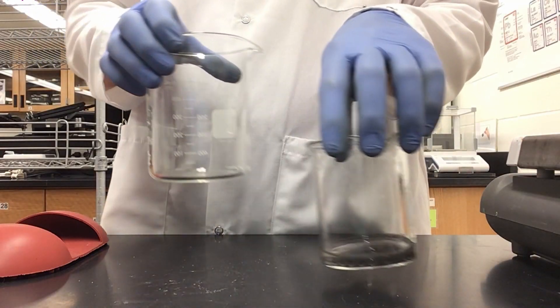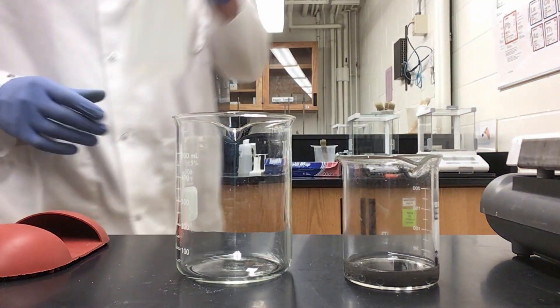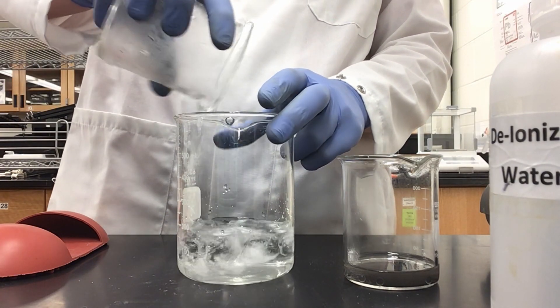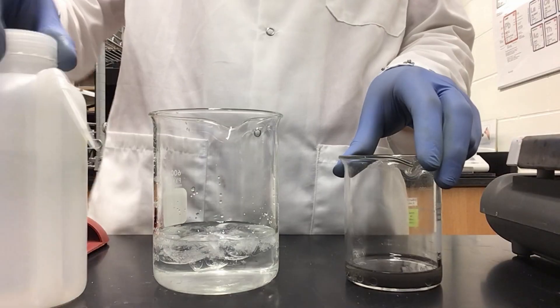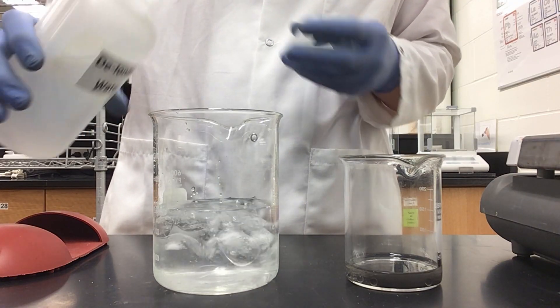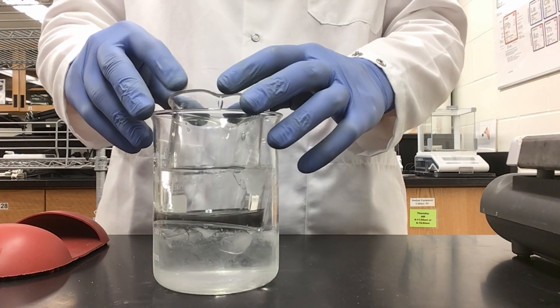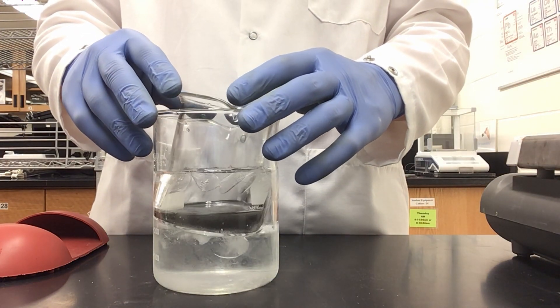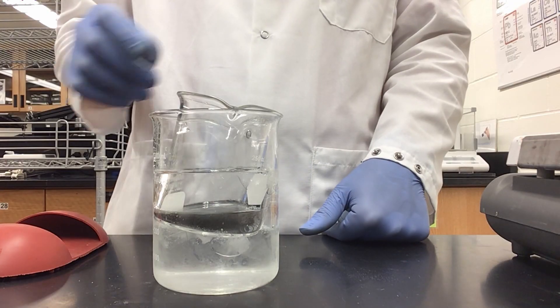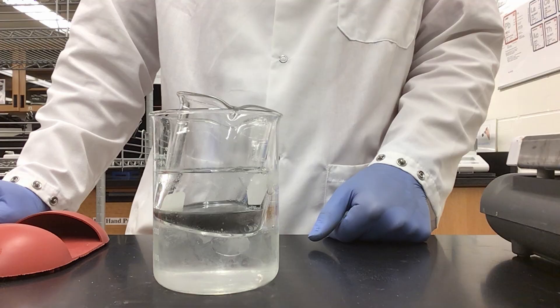Next I am going to make the ice water slurry. I have a 600 ml beaker, my DI water, and some partially made slurry from before which I can add in. I will add a little more water to get it full. As we cool, we will likely need to get more ice to refresh this step. Once it is cool, we can remove our glass beads and move on to the next step, which is adding our sulfuric acid.